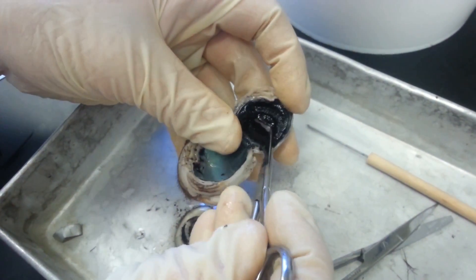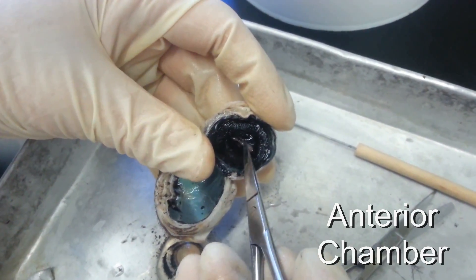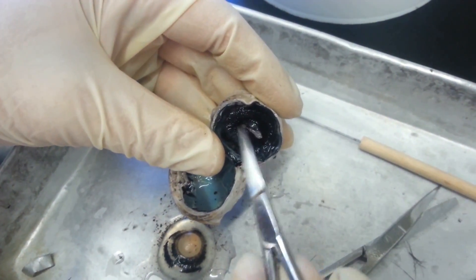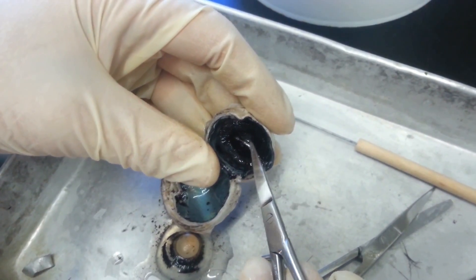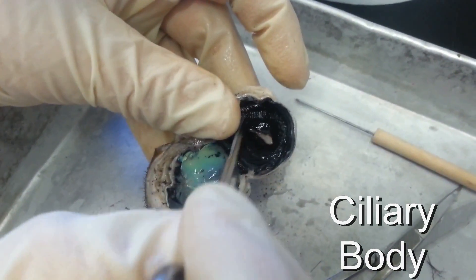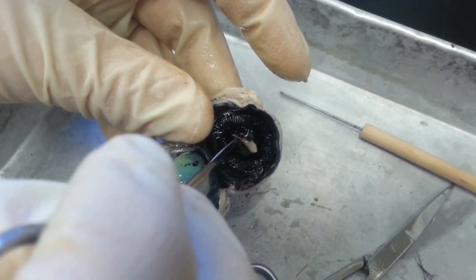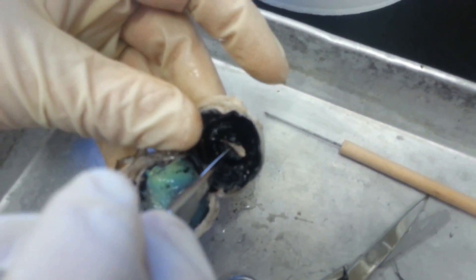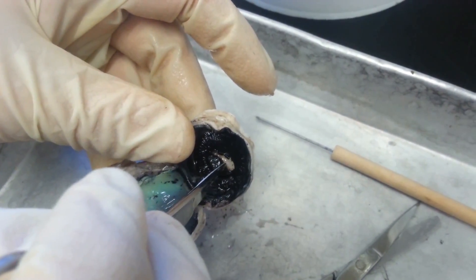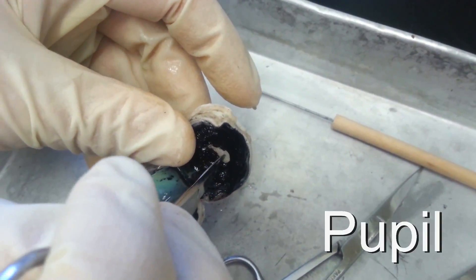From the cornea to where the lens is, that is called the anterior chamber, and then from the lens to the vitreous chamber is called the posterior chamber — so you have two chambers right next to each other. The muscle surrounding the lens is called the ciliary body — you can see there are a bunch of ridges that kind of look like cilia. There's another muscle that will contract and relax to allow light into the eye, and that is called the iris — that's the colored part of the eye, what makes your eyes blue or brown. The hole created by the contraction or relaxation of the iris is called the pupil.